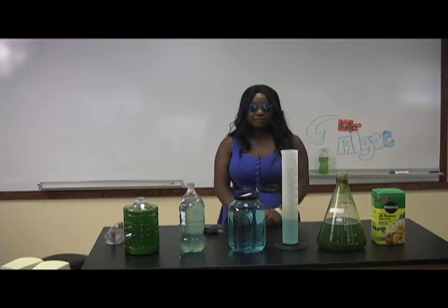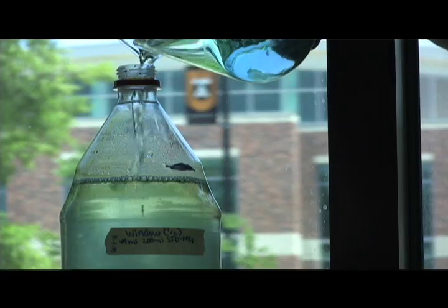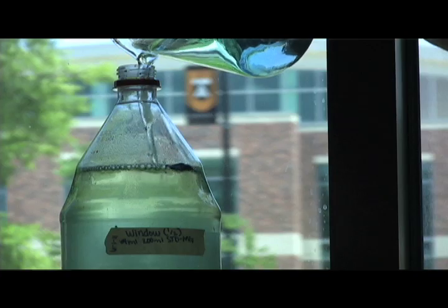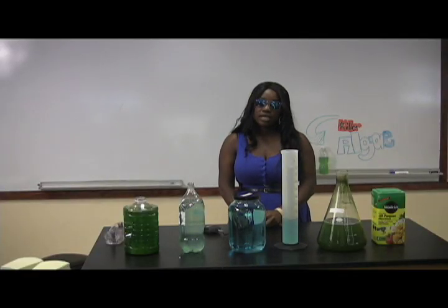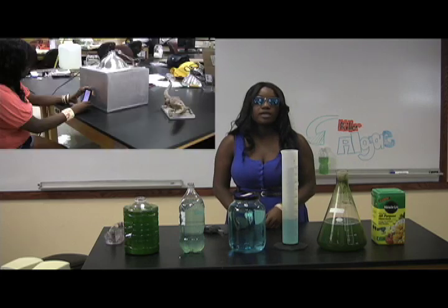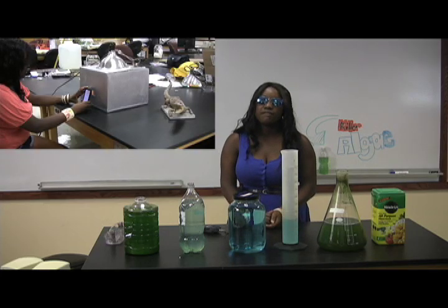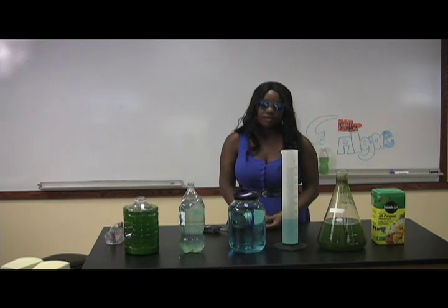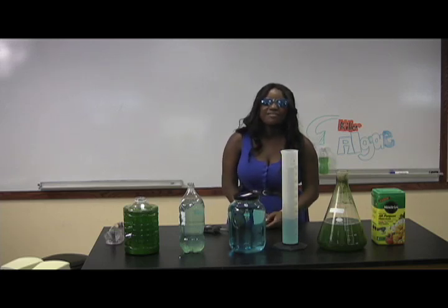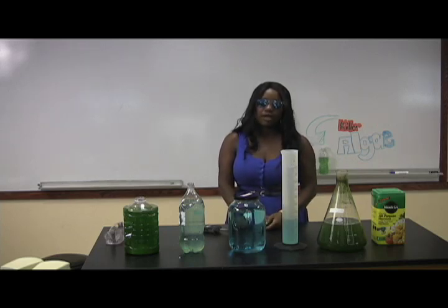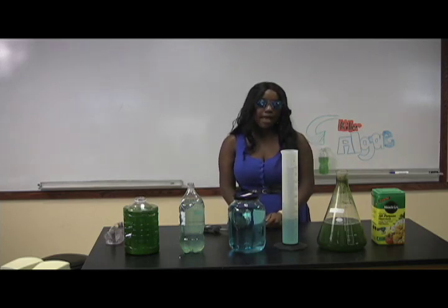For classroom setup, it is important to maintain consistent volume. When water level gets below the mark, simply add more medium. Have students make observations and take notes. To cheaply measure growth rate, we are working on developing a phone app that will give you the light density level of the algae. Follow us for further updates on growing algae for biofuel and the development of our app.